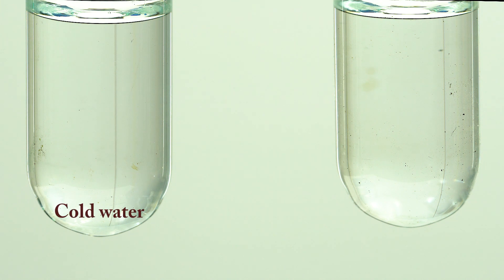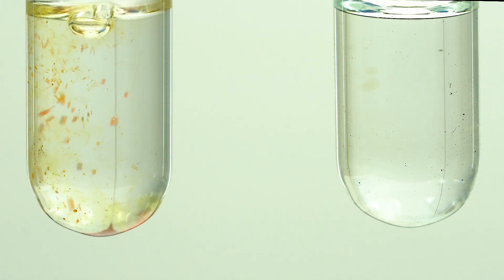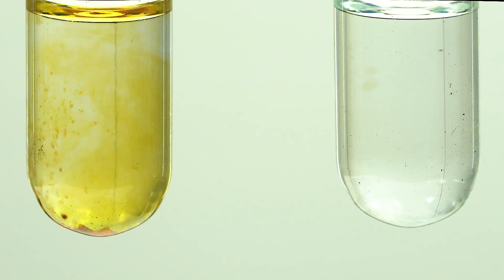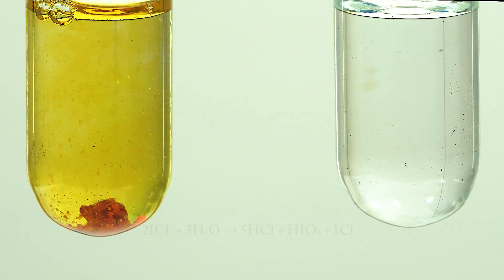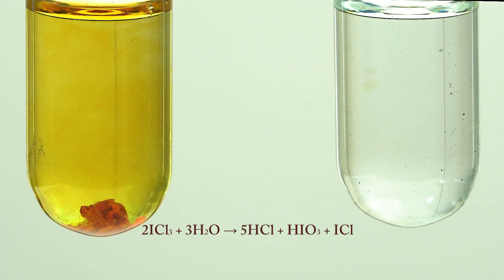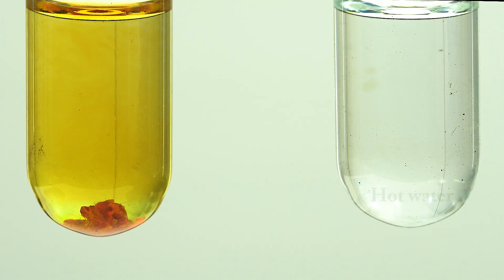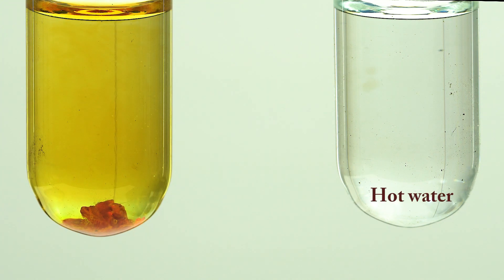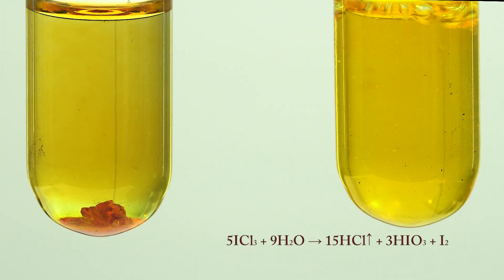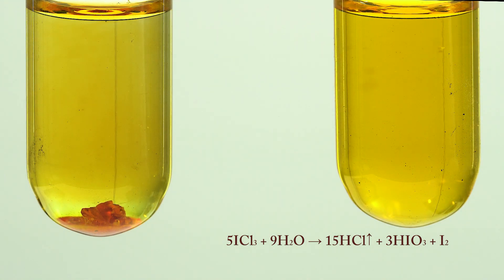Iodine trichloride reacts with water in different ways, depending on the temperature of the latter. At low temperature, it is hydrolyzed by water slowly but completely, with a formation of iodine monochloride. In the reaction with hot water, you can observe gas evolution. Hydrogen chloride is actively released during the reaction.